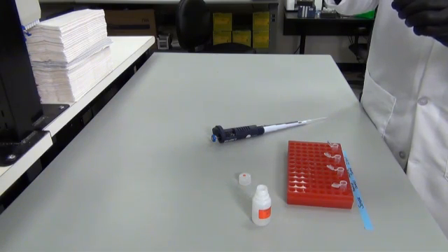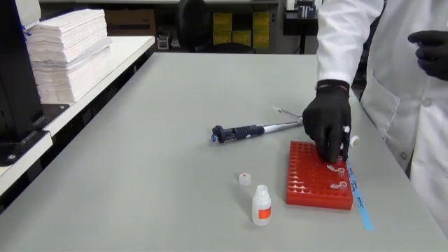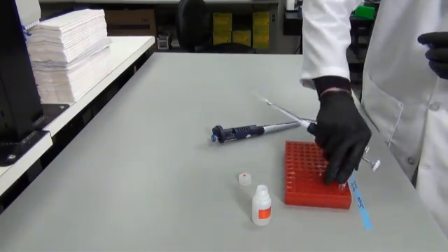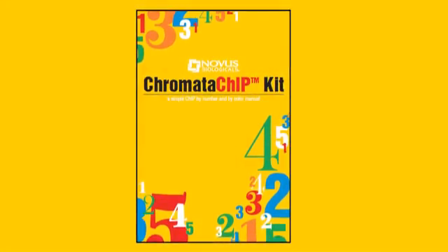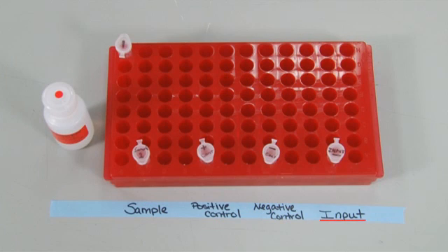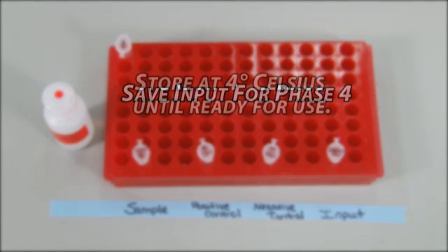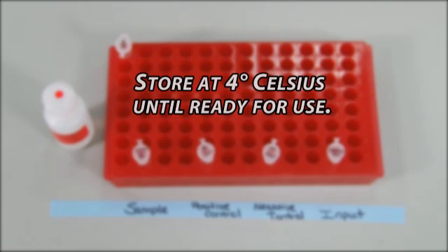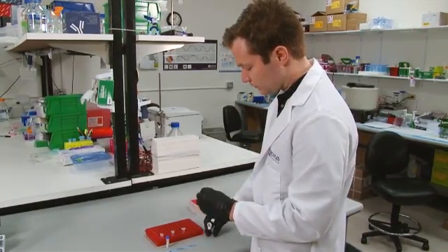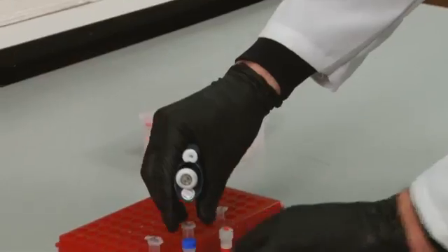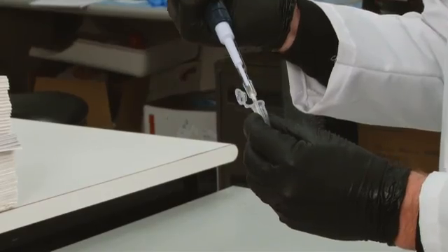It is beneficial to IP at least three samples. One will be for your antibody of interest, another will be for a positive control antibody, and a third for a negative control which will not contain any antibody and will be used to measure background levels. If you are using the ChromataChIP kit, your kit includes a positive control antibody. Dilute one last sample and label this input. This sample will not go through the IP process and instead be saved for phase 4 of the protocol. Store this at 4 degrees Celsius until ready for use. Add your antibody of interest and positive control antibody to their respective diluted samples. Then incubate overnight at 4 degrees Celsius with rotation.